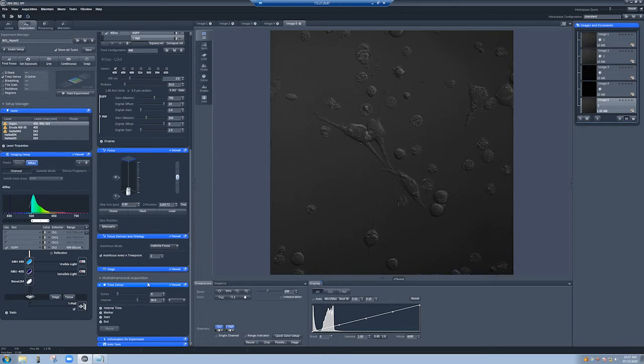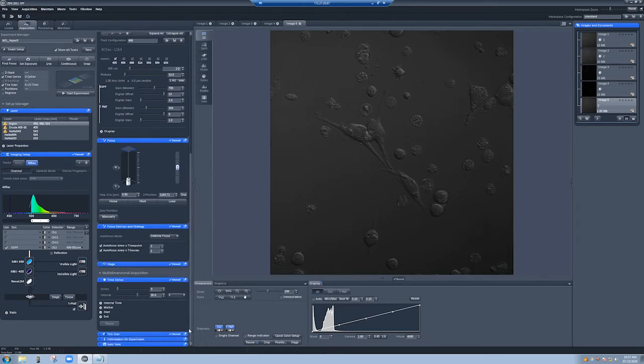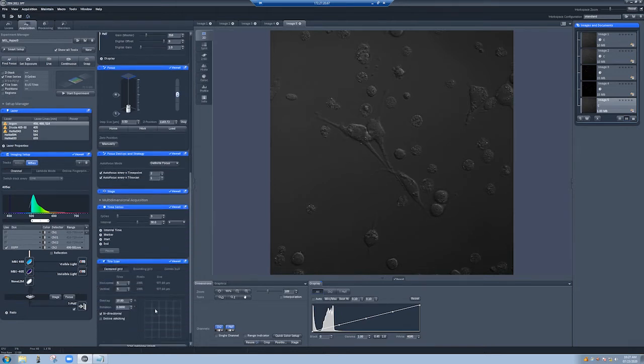So how do we add multiple positions? There are 2 ways we can do this. One is we can say, well, instead of taking this image, what I would like to do is take a bigger image, but in the same region, a 3x3. You can do that by using tile scan. If we scroll down here, this is the tile scan. So we could do something like a 3x3 centered in this same position. If we click online stitching, it'll be stitched by the time we're done.